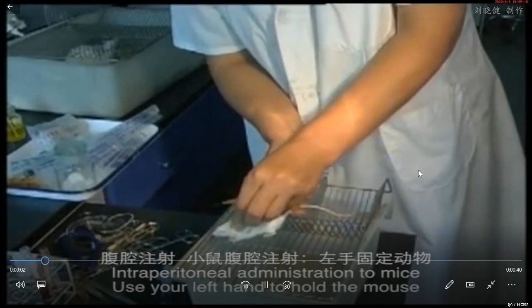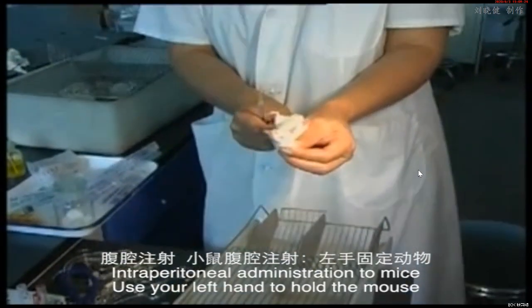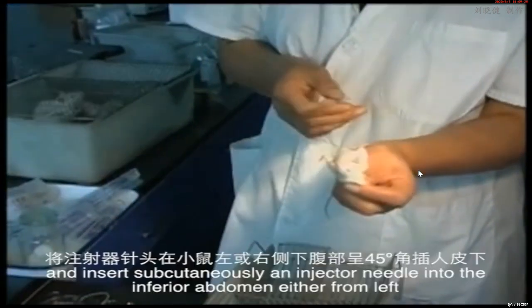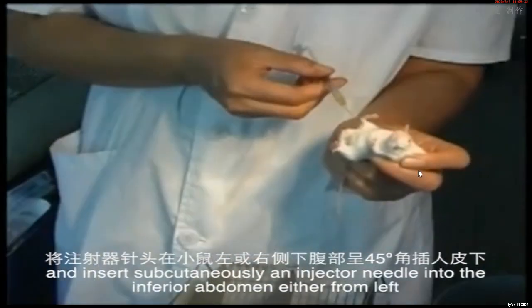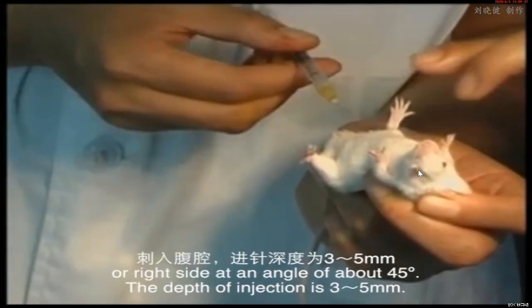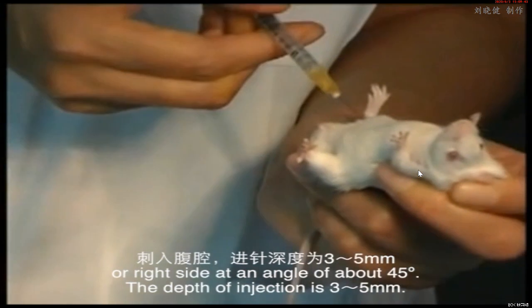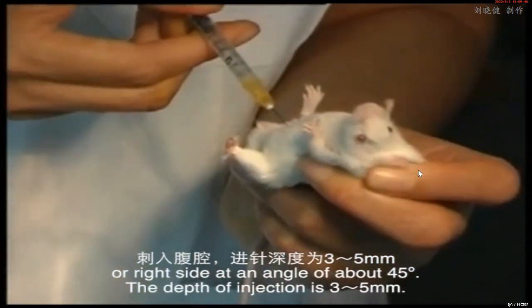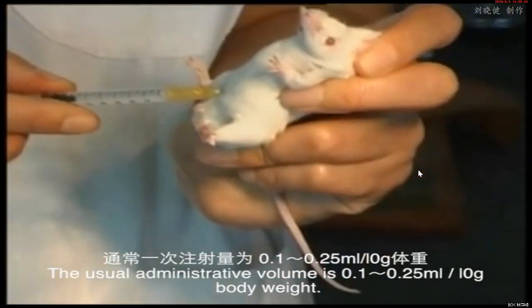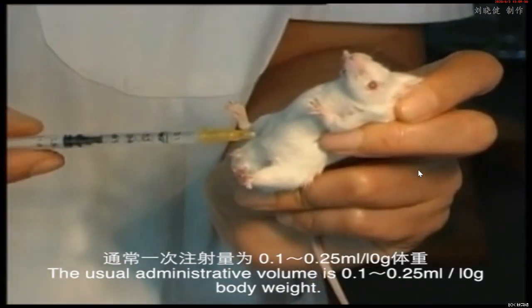Intraperitoneal administration to mice. Use your left hand to hold the mouse with its abdomen facing upwards and head downwards, and insert the injector needle subcutaneously into the inferior abdomen either from the left or right side at an angle of about 45 degrees. The depth of injection is 3 to 5 mm. The usual administration volume is 0.1 to 0.25 milliliter per 10 gram body weight.